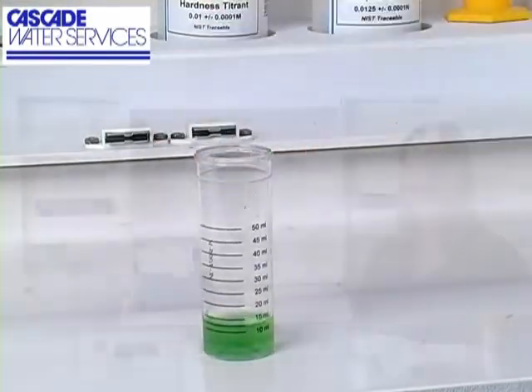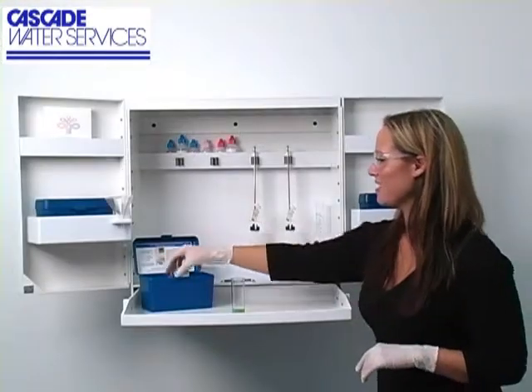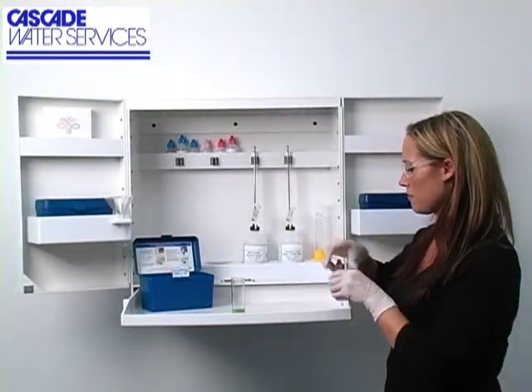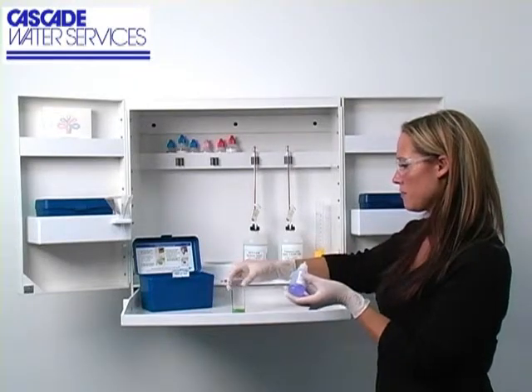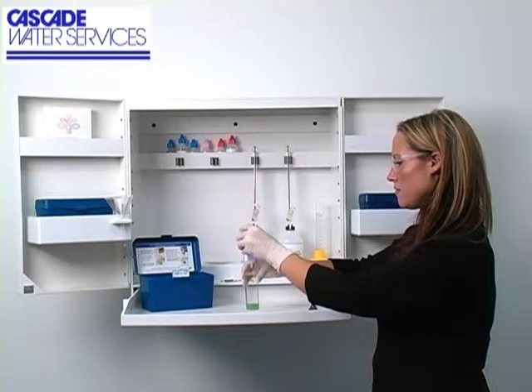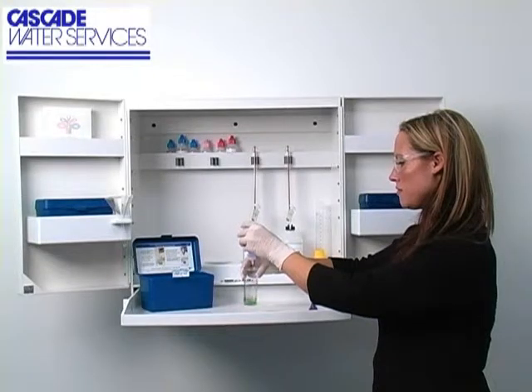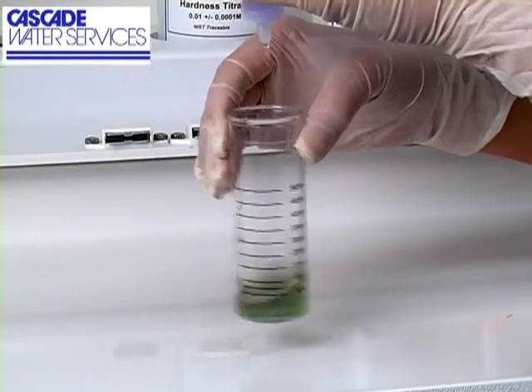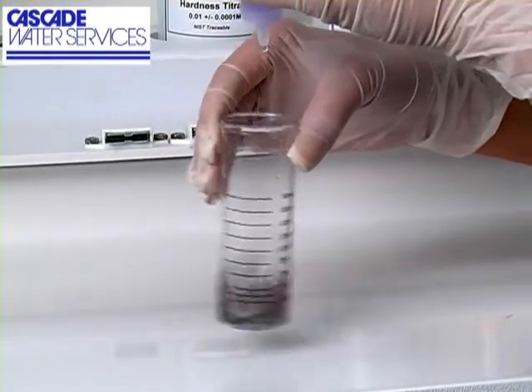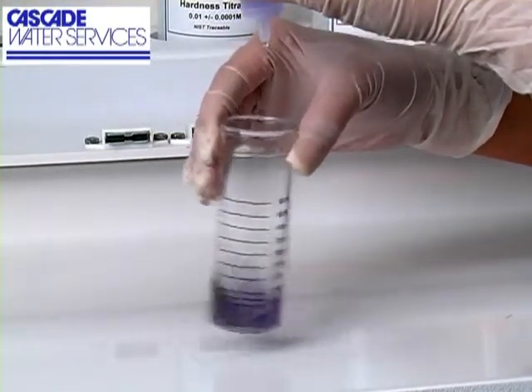The next step according to the endpoint ID procedure is to perform the titration. Each bottle of titrant is labeled with the equivalency and sample size it was manufactured for. It's important to make sure you have the proper titrant and the proper sample size for this titration. The bottle of titrant contains a dropper tip, therefore it's important to hold the bottle vertically to make sure you get a consistent drop size.